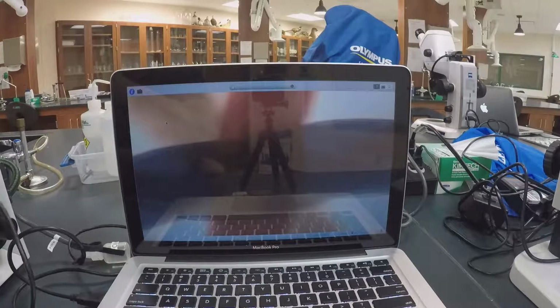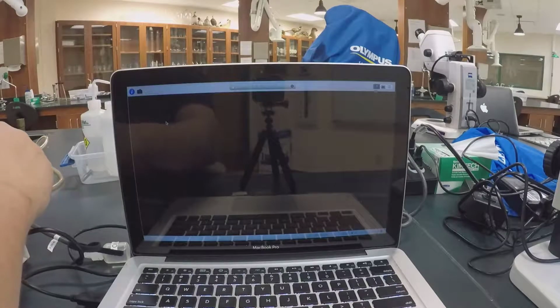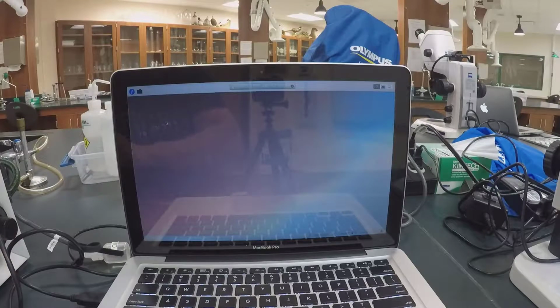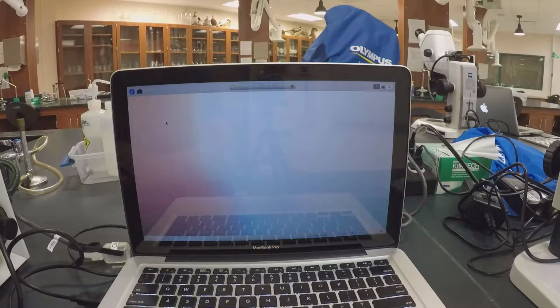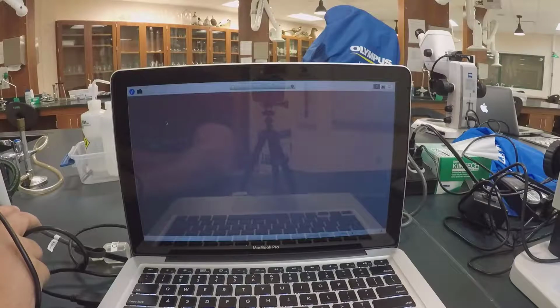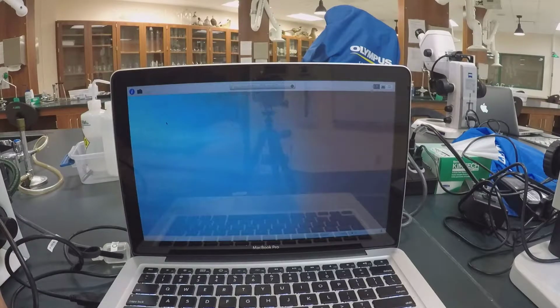Okay, so that's 10 times your eyesight, or 100 times your eyesight. Here's 400 times your eyesight. I'll have to increase the light that's coming through. Let me see if I can get some more light to come through, and you're going to see that it's going to be really difficult for you to tell which one's on top. I don't even know if I can get it to focus on the computer screen to see which one's on top. So I'll have to move it out from the center here.